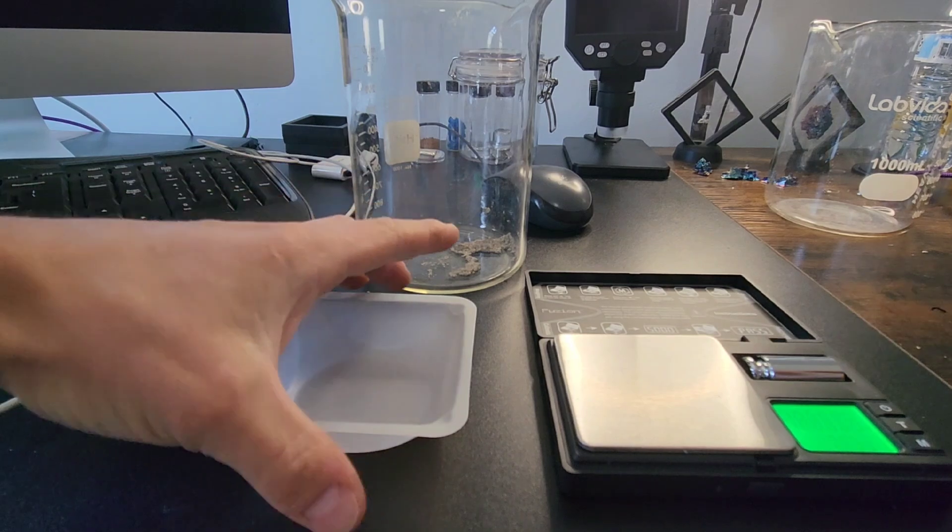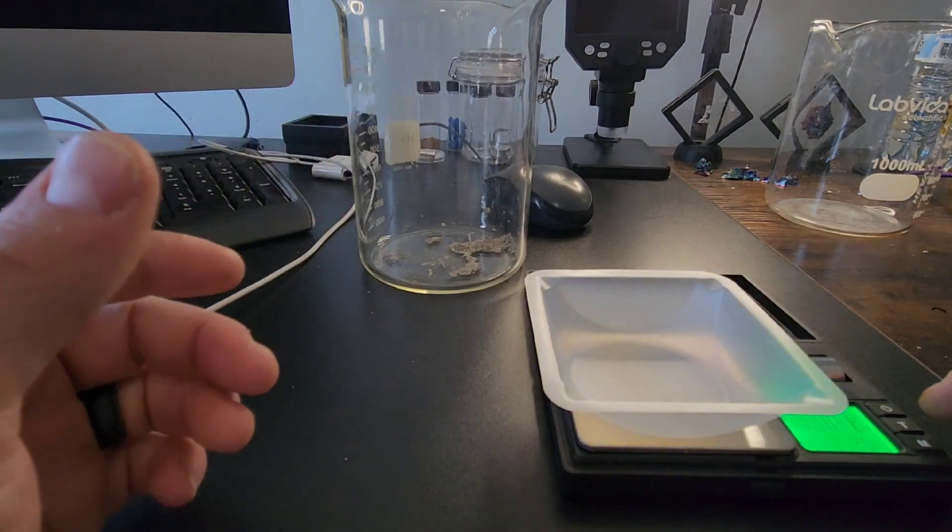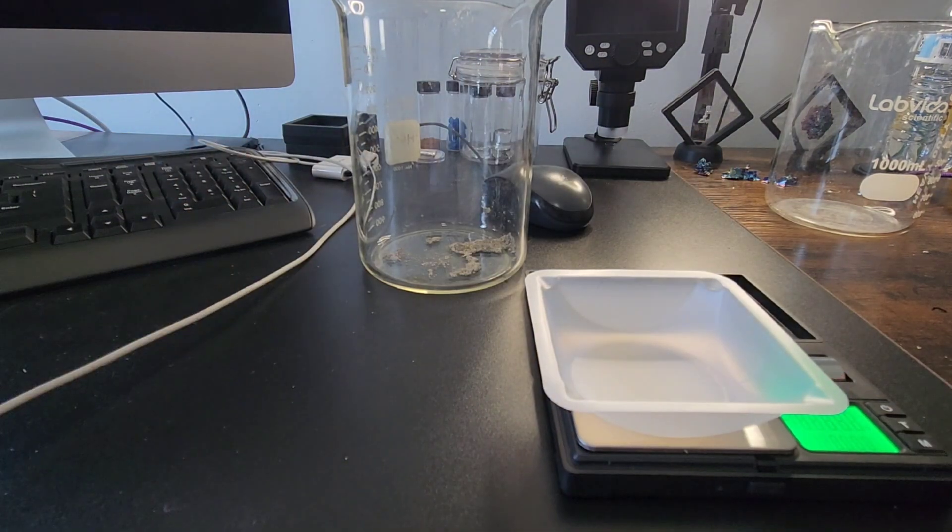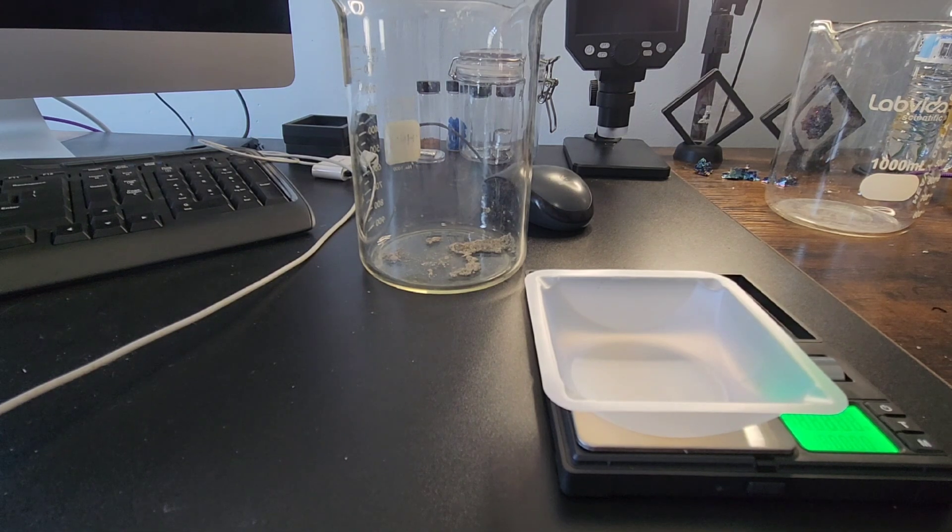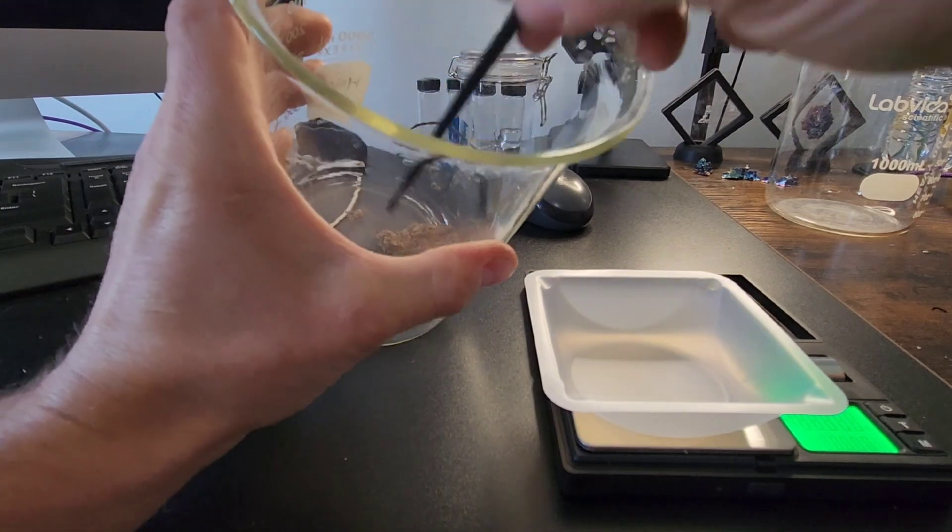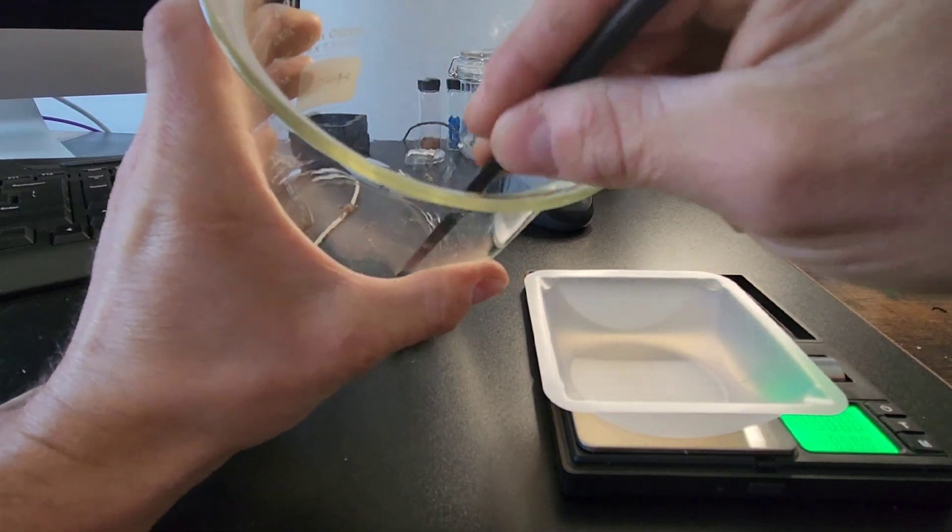All right, let's get a weight on this bad boy. So we'll go ahead and zero that out. Break this stuff up a little bit.